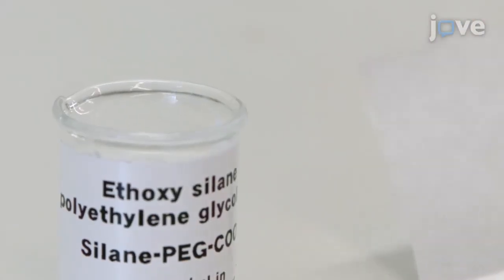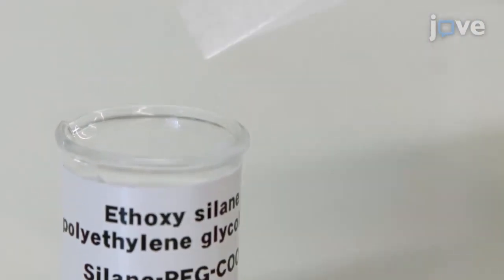Meanwhile, dissolve ethoxysilane polyethylene glycol acid in a mixture of ethanol and doubly distilled water.